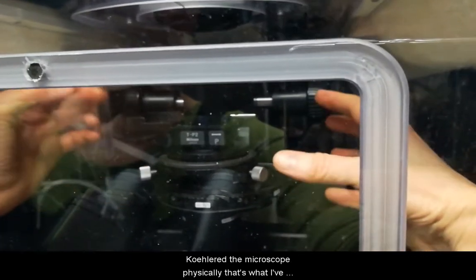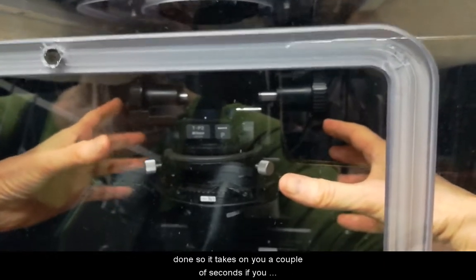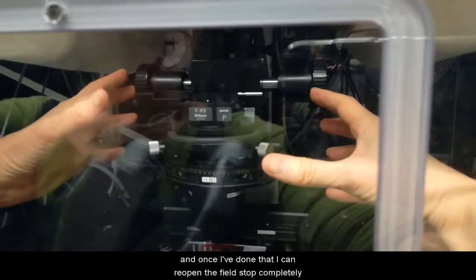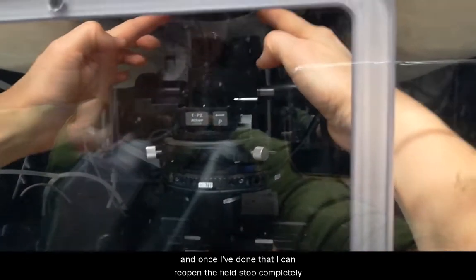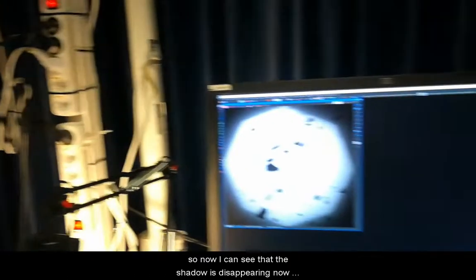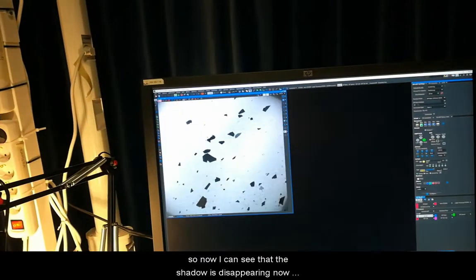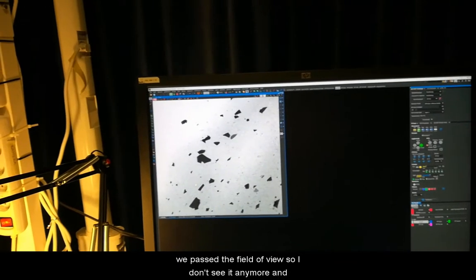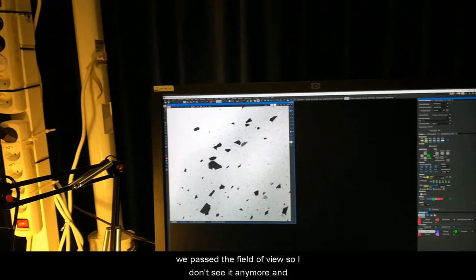So now I have done Köhler illumination on the microscope — physically, that's what I've done. It takes only a couple of seconds if you don't stop to speak. Once I've done that, I can reopen the field stop completely. Now I can see that the shadow is disappearing past the field of view, so I don't see it anymore.